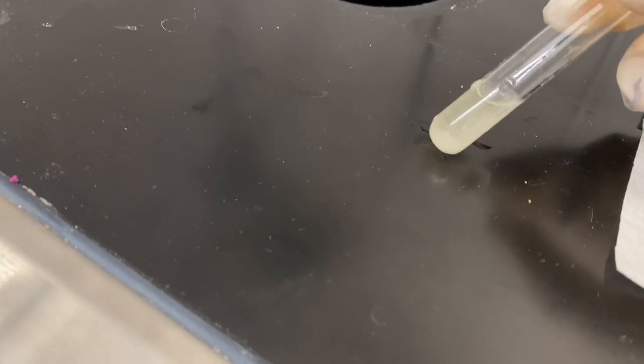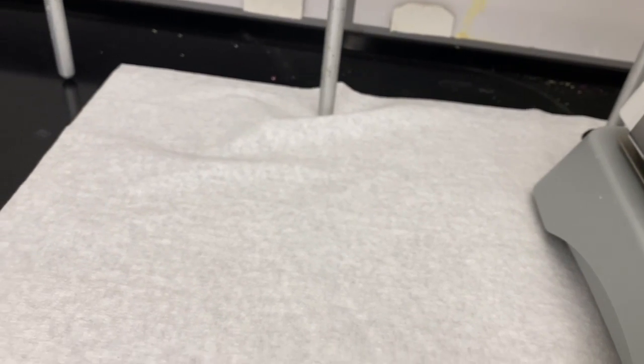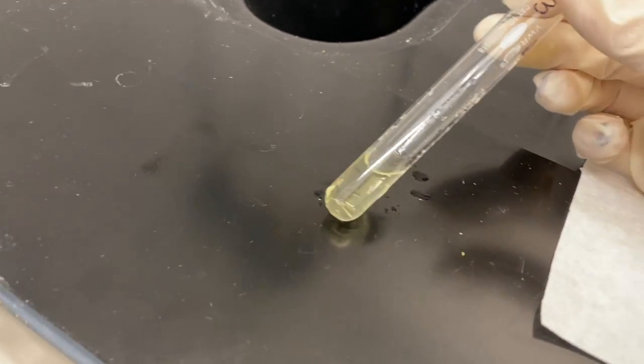Number 5 is our secondary alkyl bromide. So you see we actually do have quite a bit of solid in there. Maybe not as much as our initial primary bromide, but a pretty decent amount of solid at the bottom there. Remember, number 4 was the one that worked at room temperature, so we're going to move on to number 3. And we still don't see a reaction as indicated by no precipitate.